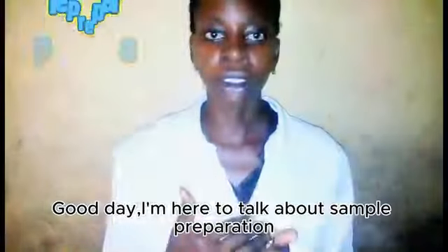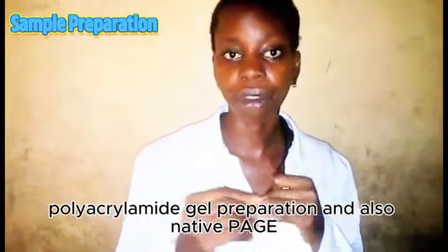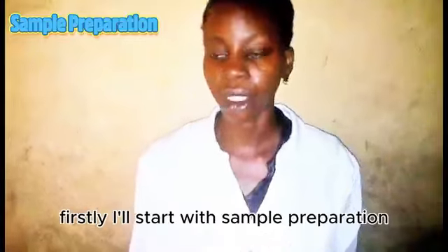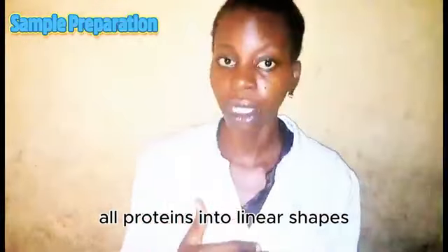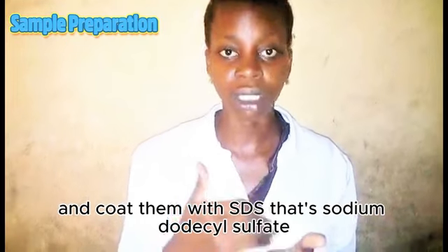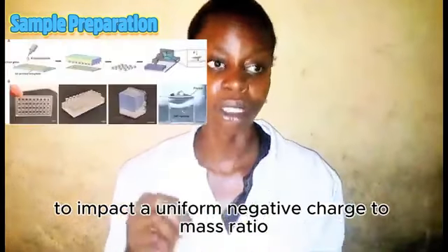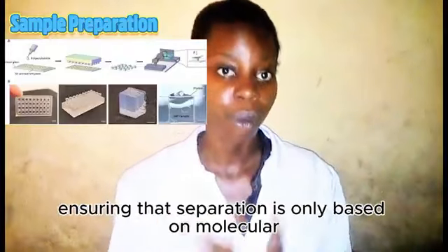Thank you. Good day, I'm here to talk about sample preparation, polyacrylamide gel preparation, and also native PAGE. Firstly, I will start with sample preparation. In this sample preparation, the goal is to denature all proteins into linear shapes and coat them with SDS, that's sodium dodecyl sulfate, to impart a uniform negative charge to mass ratio, ensuring that separation is only based on molecular weight.